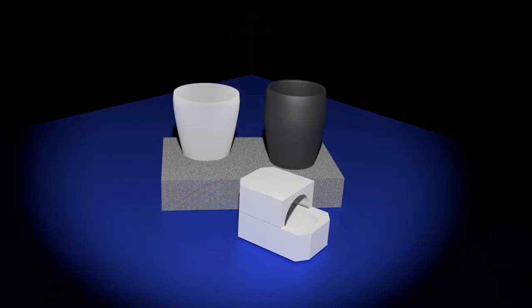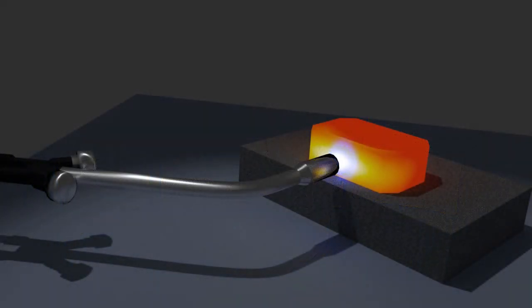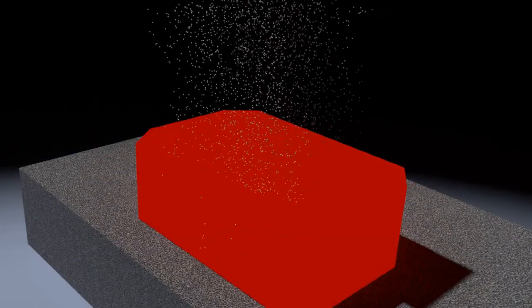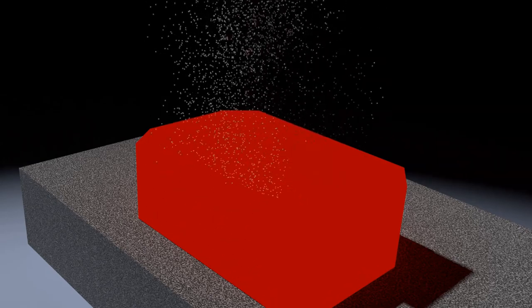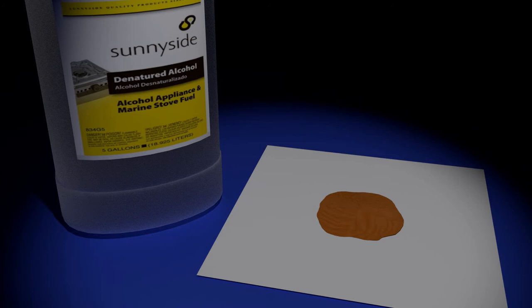Preparing your crucible. Select either an unused crucible or one that has only been used to melt refined gold. When using a fresh crucible, you must first flux it, sealing its pores, thus preventing it from absorbing gold. Heat your crucible to red hot. Sprinkle flux on the inside of the crucible. A mixture of 50% borax and 50% boric acid is the most commonly used flux. The flux will melt rapidly, forming a thin glaze and sealing the crucible's pores. Wrap your gold powder in jewelers tissue paper. If that is not available, you can use a small section of a paper towel. Soak the wrapped gold powder in alcohol and place it in your crucible. The paper and alcohol will help secure the powder so that the air currents produced by the torch flame don't blow it away. Both paper and alcohol will burn away, leaving no trace.